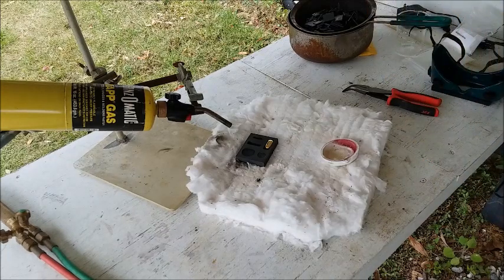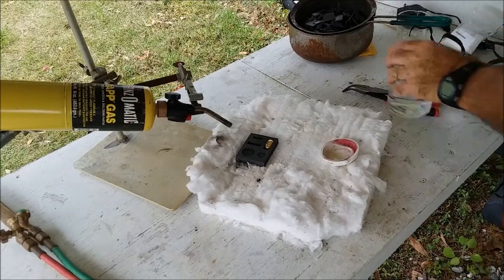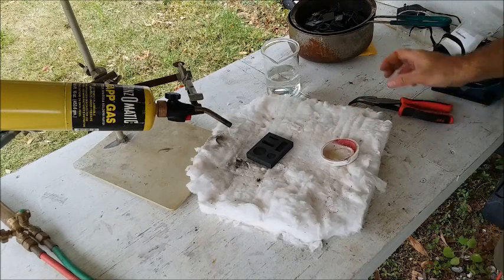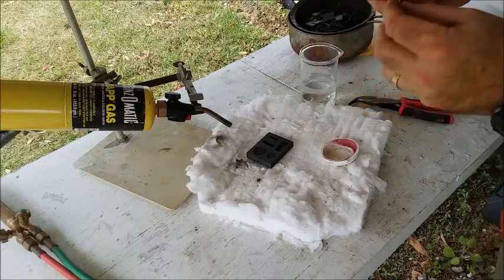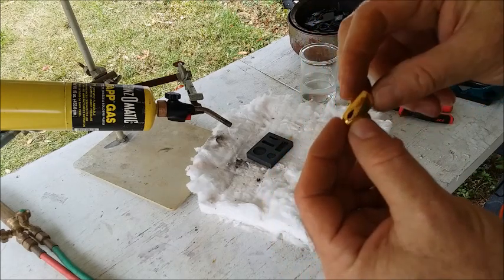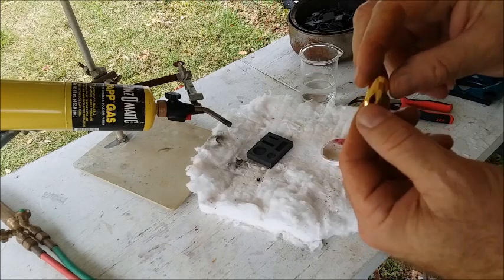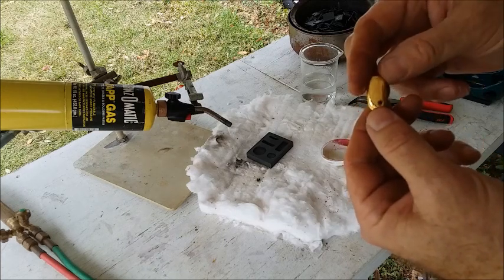I need a little water to quench it in. Oh, that could have broke the beaker — that's a big piece of gold there. There we are: 18.3 grams, 24 karat gold — at least I hope it's 24 karat. It sure looks a lot better than the last ones I cast. Those had a little bit of a funny film on them that I think was other metals coming to the surface during crystallization, but this has nothing. It's just as shiny as can be.